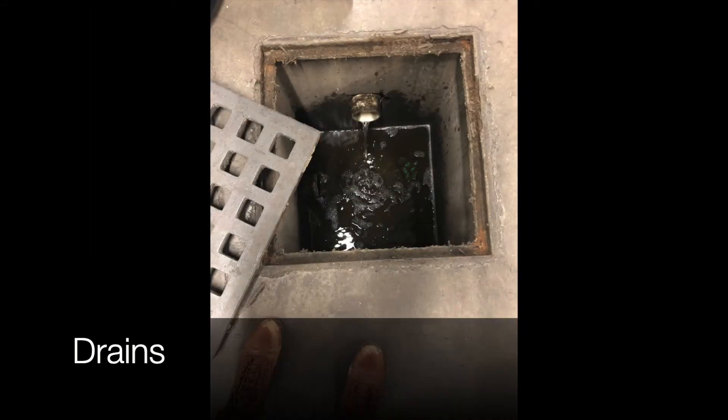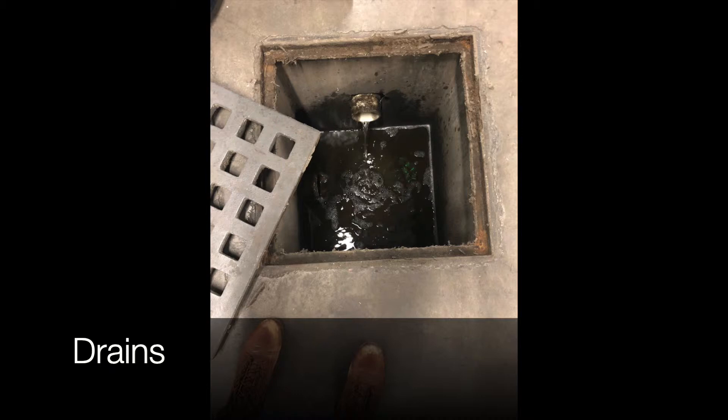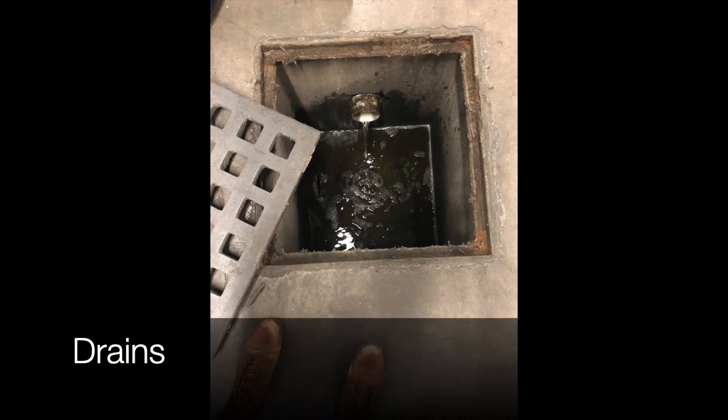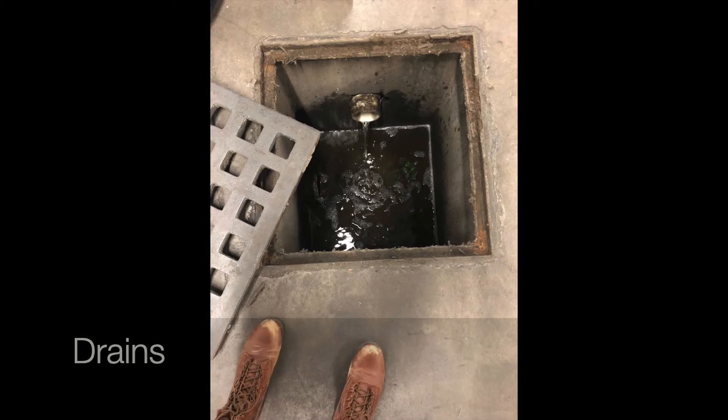Drains: Always sample drains because they are an easy way to capture the worst-case scenario of the whole room, as water that has touched equipment and floors flows into drains. If Listeria are present in a room, it's likely that it will end up in the drain. Look at collection pans deep in the drains that usually don't get cleaned.